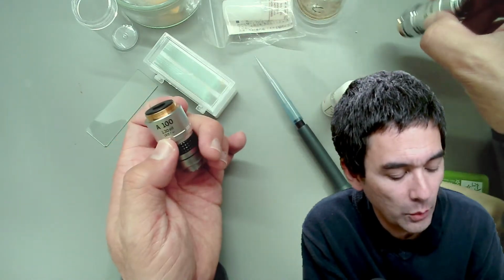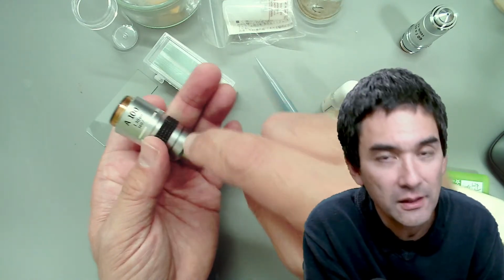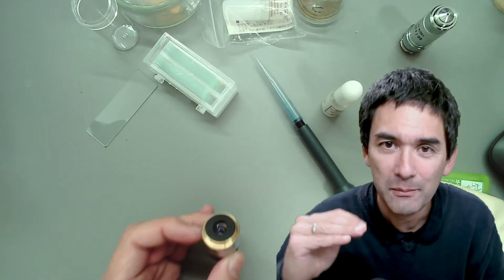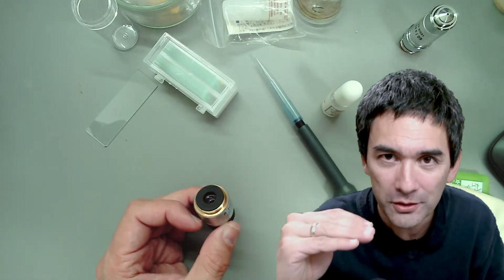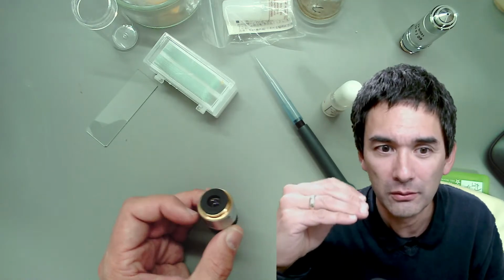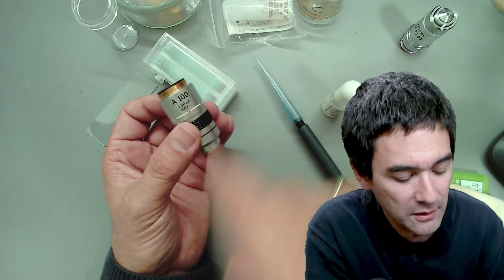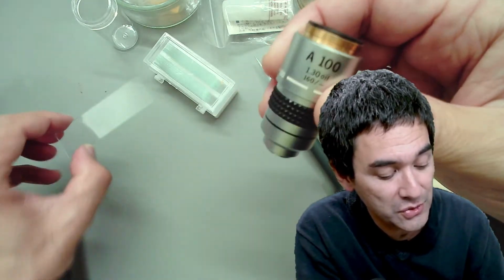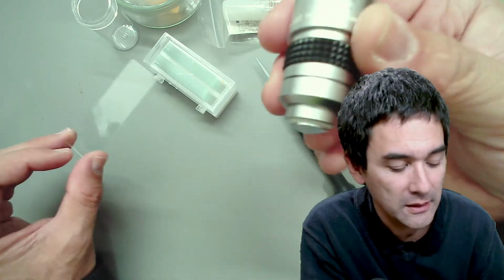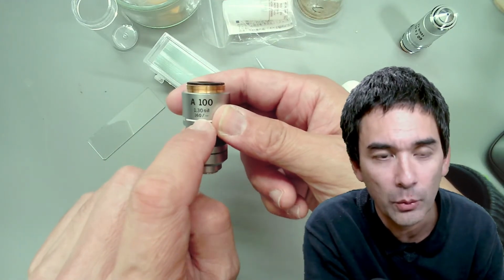Now over here in an oil immersion objective, you don't have that because the lens does not, under quotation marks, see a cover glass, because the light will be first in water, then in a cover glass, and then in the oil. And so the lens actually does not see the cover glass, so to say. For this reason, and also because it's possible to use a slide without a cover glass for oil immersion, as I'm going to show you in a minute, there is no cover glass thickness written on many oil immersion objectives.